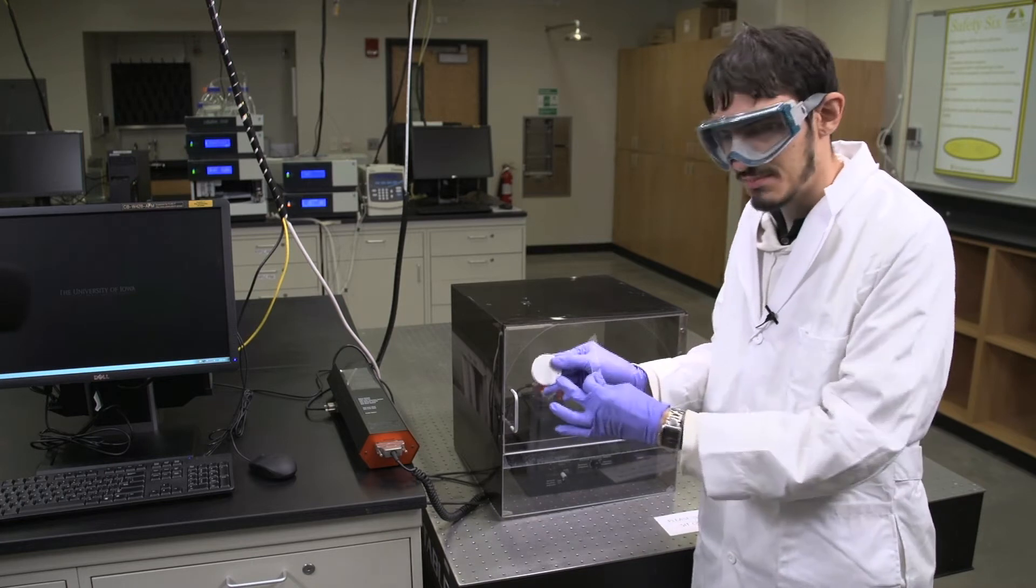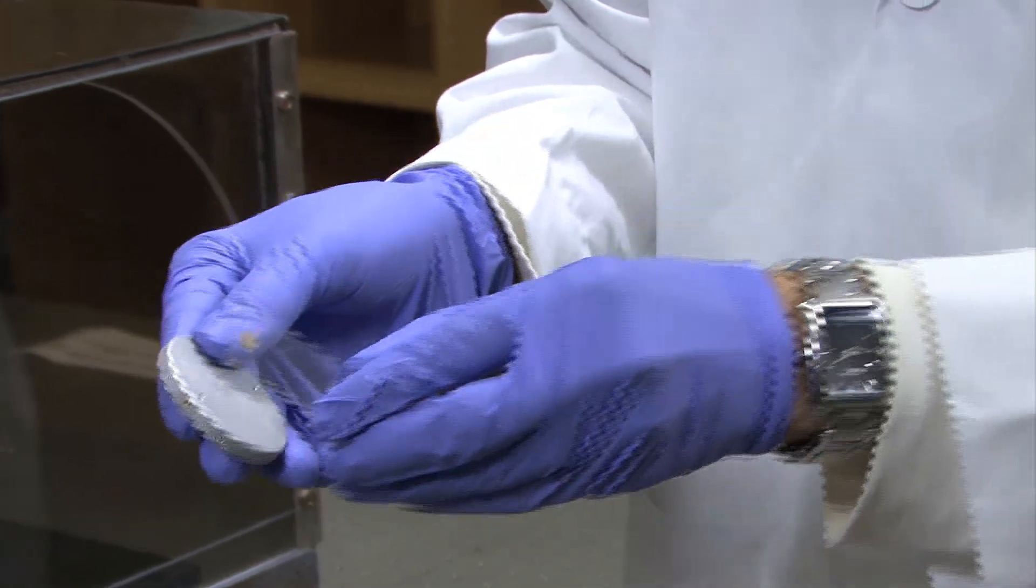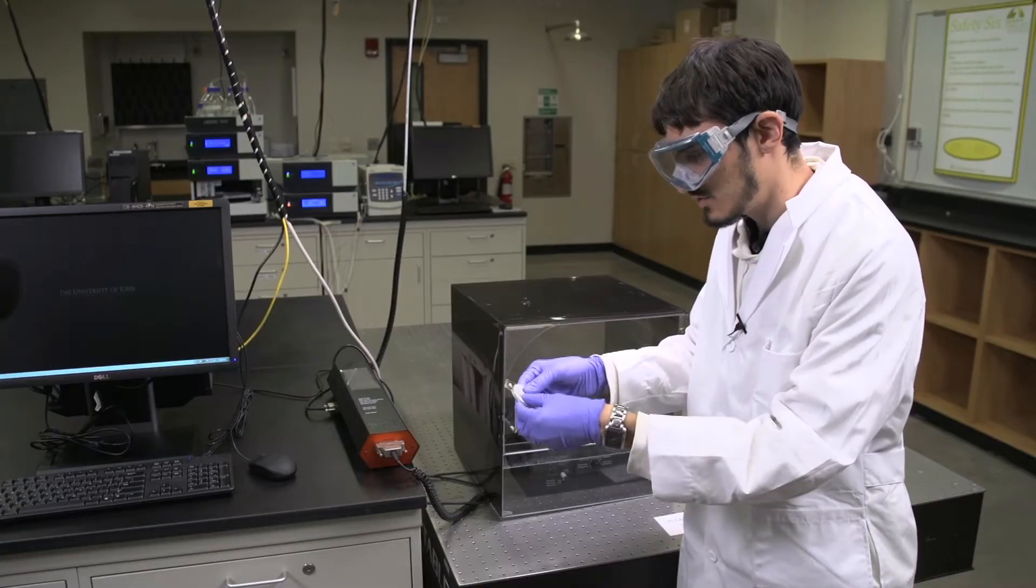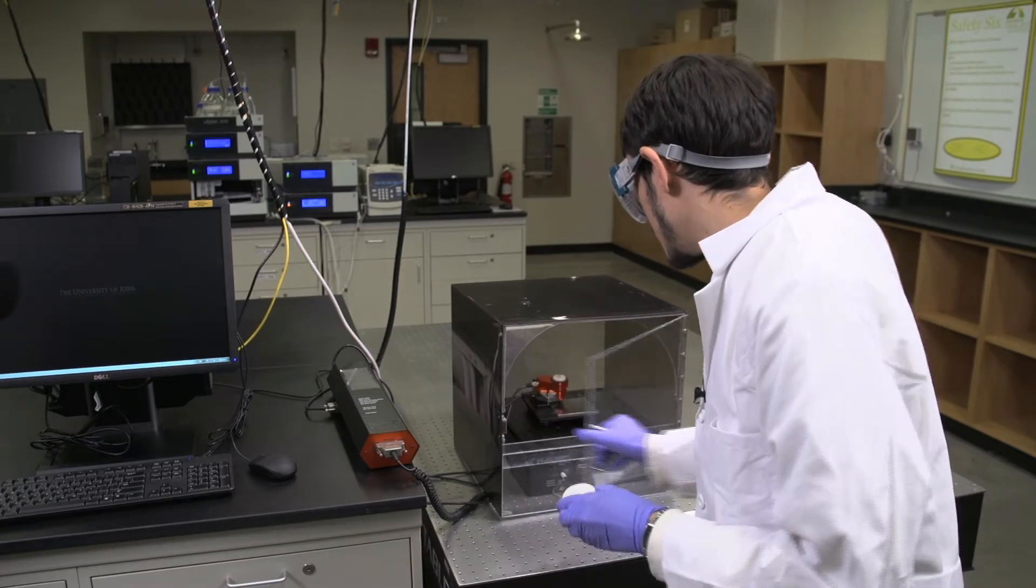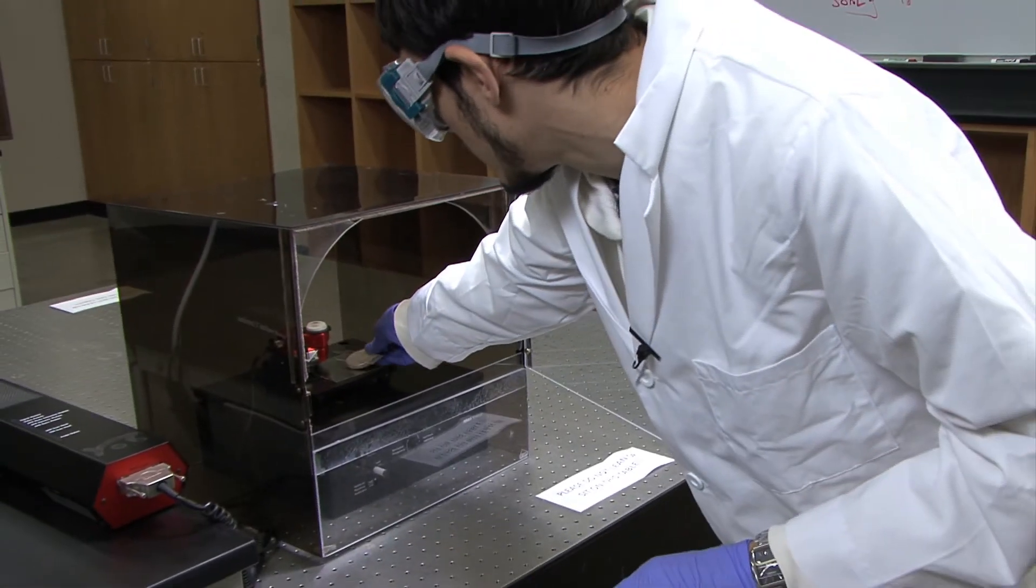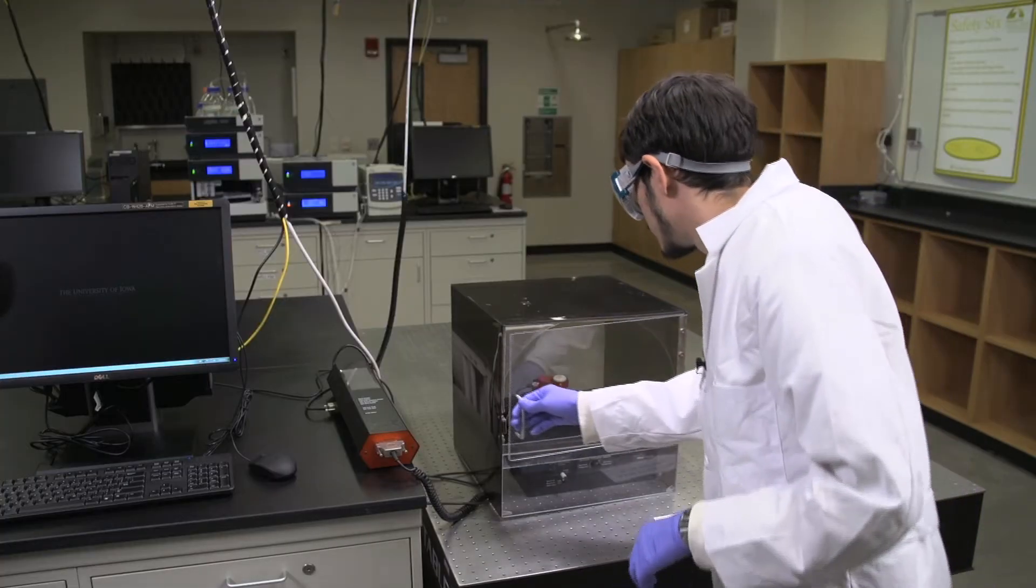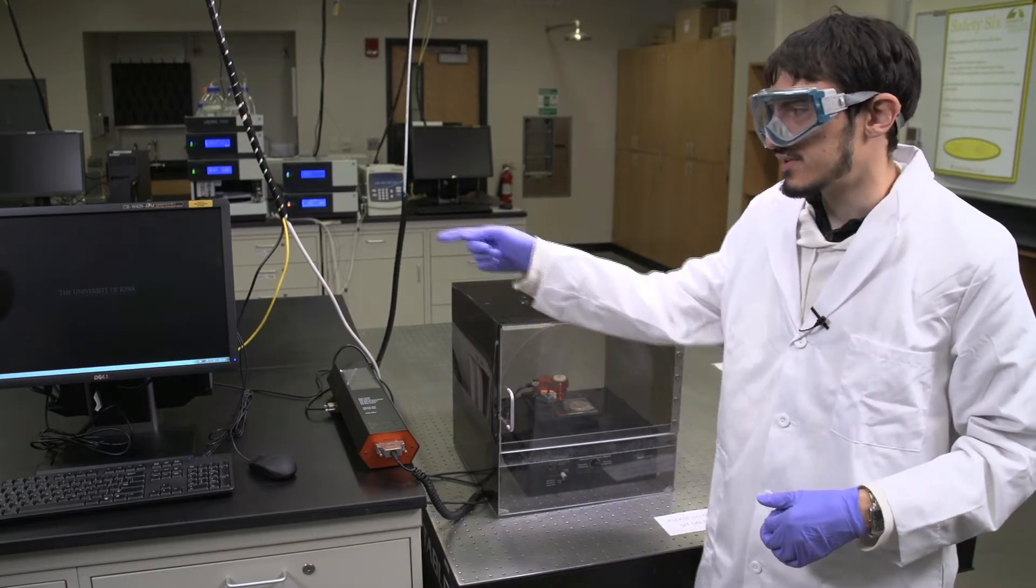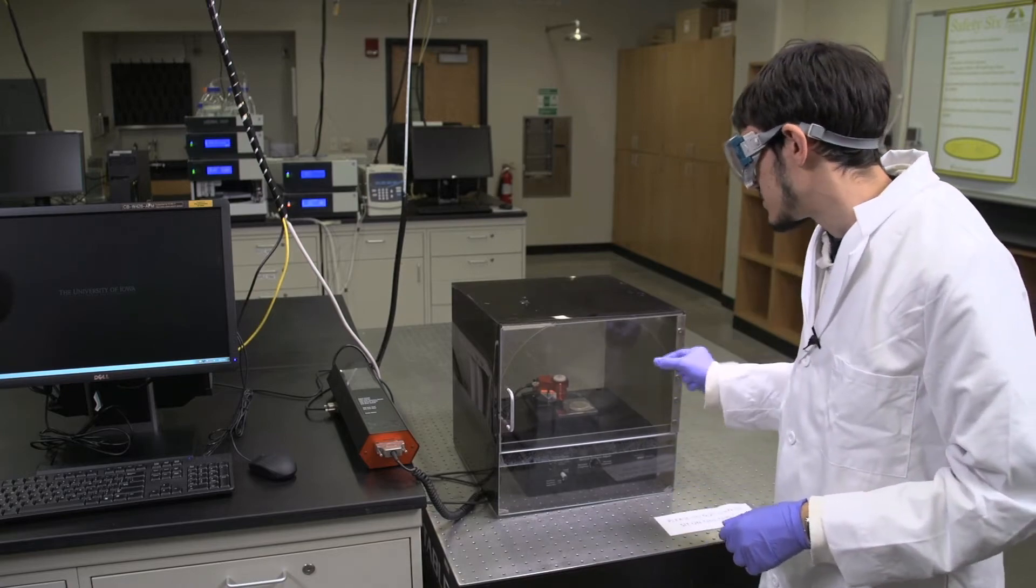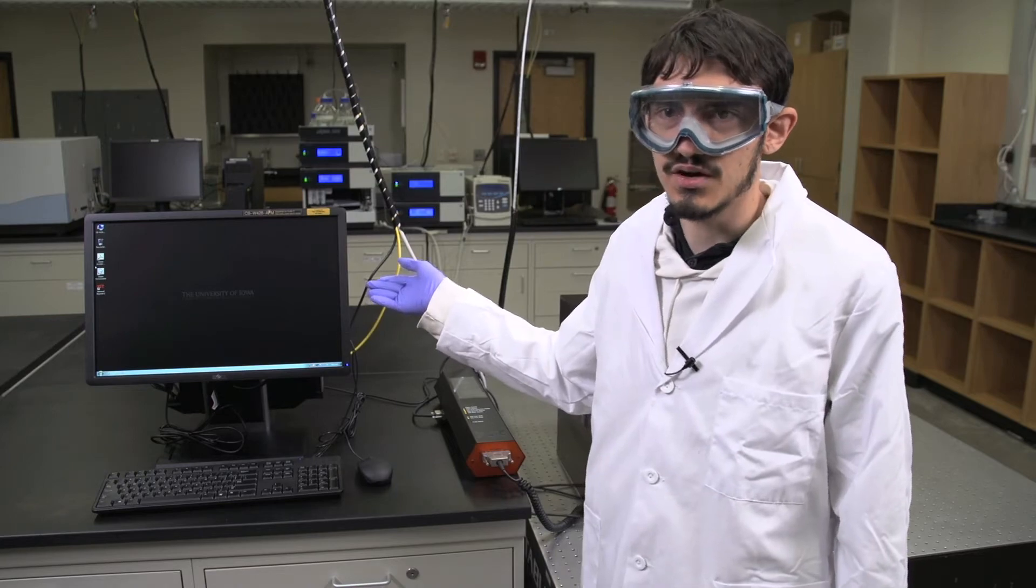There's a piece of double sided tape on it. And carefully stick your slide with the gold substrate and self-assembled monolayer on it to the stage, making sure it's firmly on. Place the stage back in the vicinity of the microscope, make sure it's on the magnetic strip. Close the draft box and you're now ready to turn on the instrument and operate the computer such that you can place the sample under the tip. Be sure to turn on the power source to the AFM instrument before operating the software on the computer.